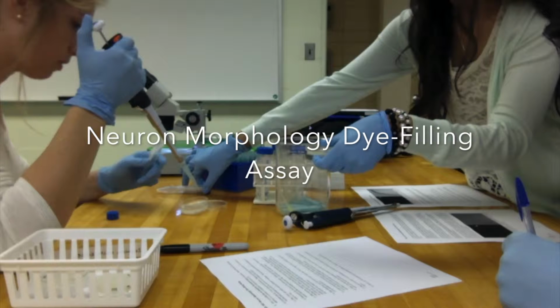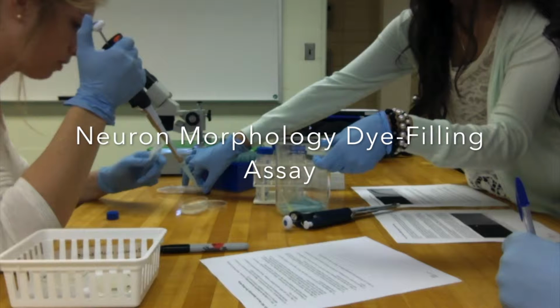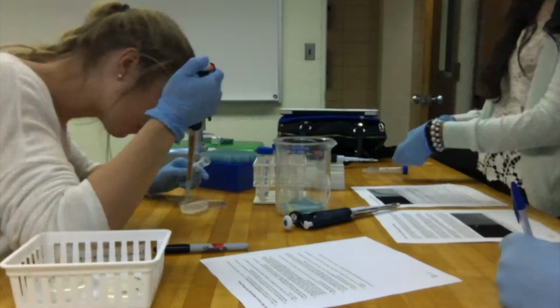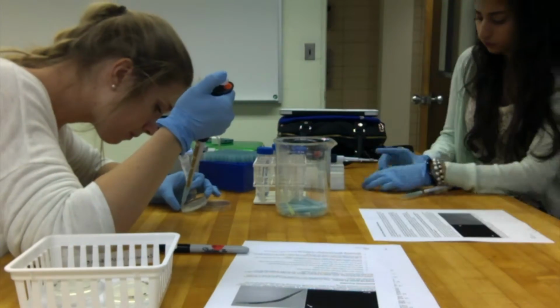elegans to uptake lipophilic dye in the neurons, a neuron morphology dye-filling assay was performed. The purpose of this assay is to determine if the development of sensory neurons is normal. Performing the assay can also demonstrate the proteins and genes that are associated with the function and development of sensory neurons.